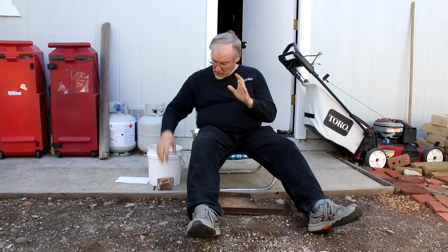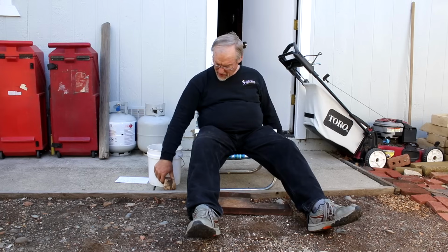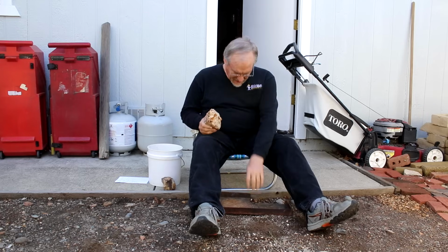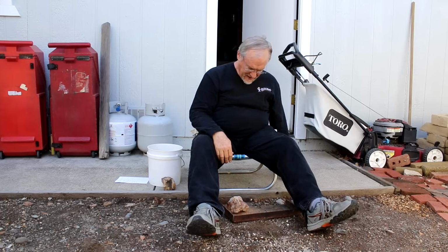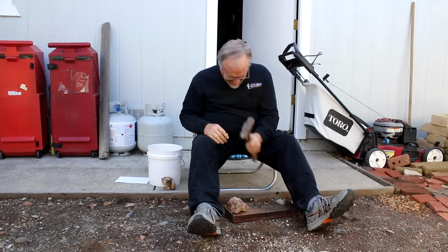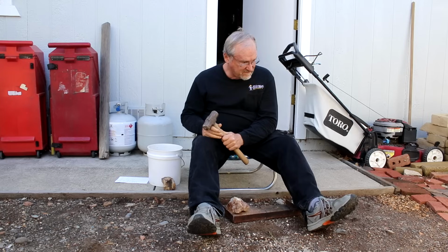So what I do have, and I wanted to show you, is I've got some rocks here that are basically just too big to go into my little jaw crusher, and I've got to take my little flat piece of steel and a hammer and bust them up. So I'm gonna do a little bit of that right now. I'm gonna start with doing that, and anyway, I'll get this done and then I'll show you.